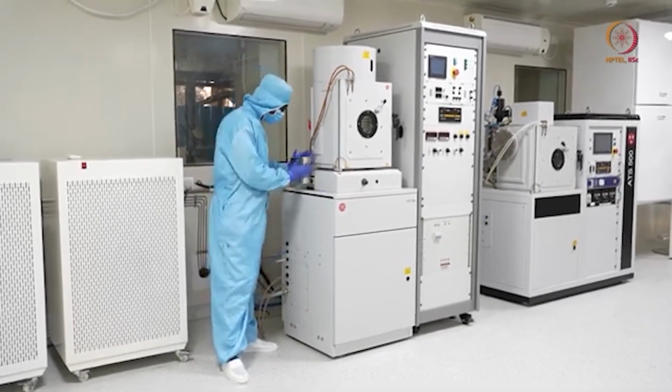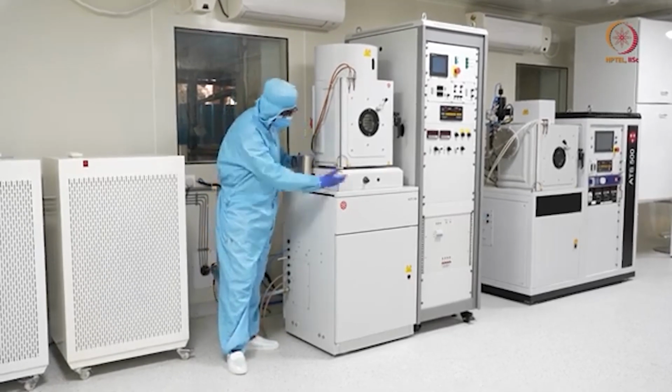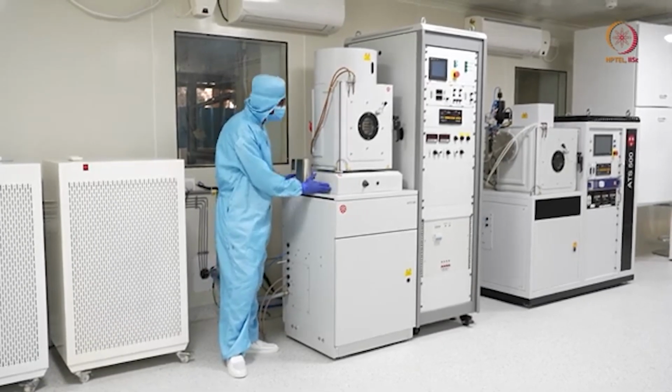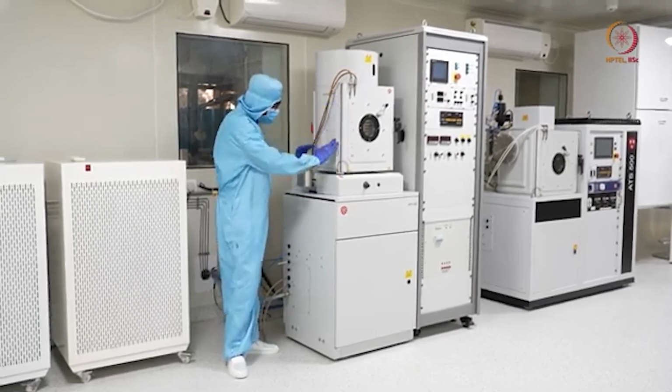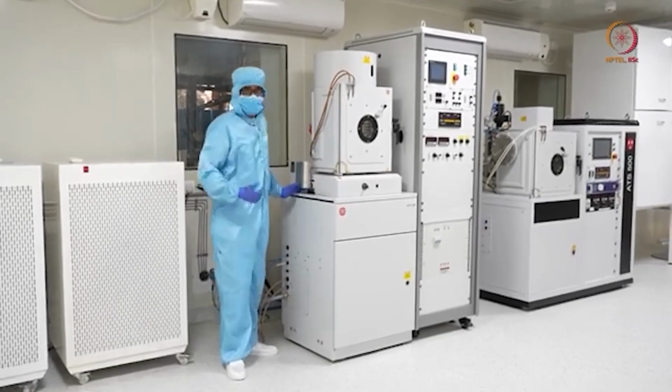Okay, so here we can just pour liquid nitrogen. It will go inside. You can see the port from here. It will be inside there below this chamber, and as the chamber is open there, whatever molecules are there will go there and get stuck, and eventually be pumped out.